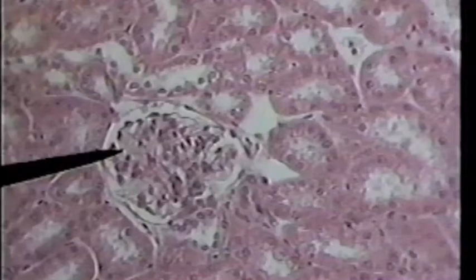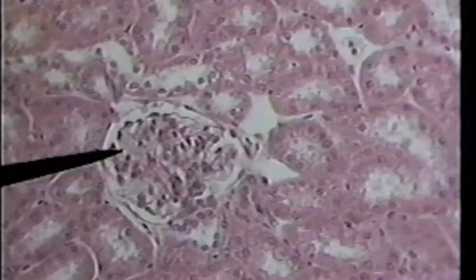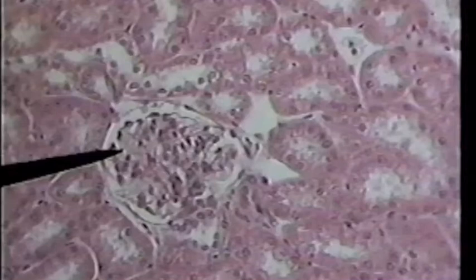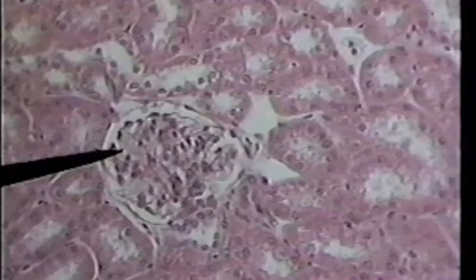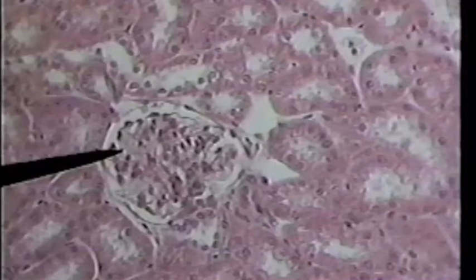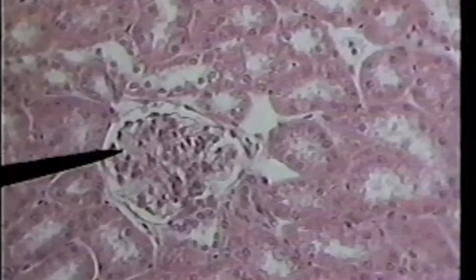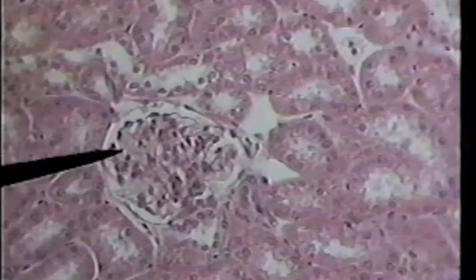If you will note, there is a lumen in the center of each, and each is lined by a single layer of cuboidal cells — that is, cells that are about as tall as they are wide. There is a basement lamina that separates that tubule from its neighbor. So what I want you to take note of here is that simple layer, or simple cuboidal epithelium.